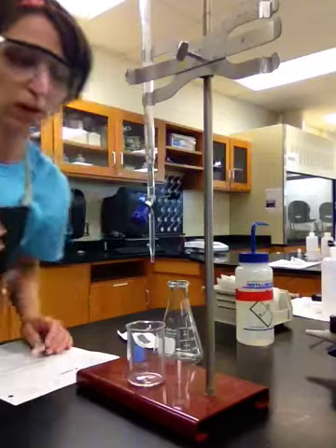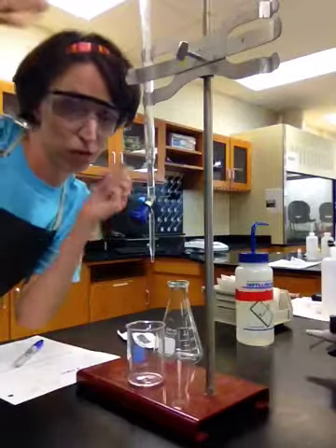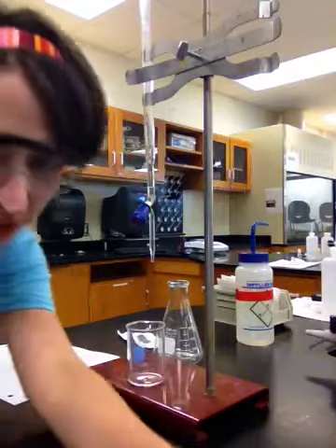Okay? All right, now, to do a titration, we get to use a really fancy piece of equipment called a burette. Okay, it's spelled like one of those little French hats, like a beret, but it's a burette. Let me show it to you. Okay? Sorry if you're getting seasick. Okay? So here's the burette.